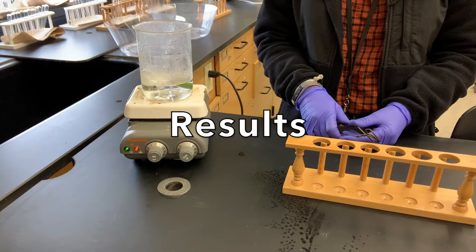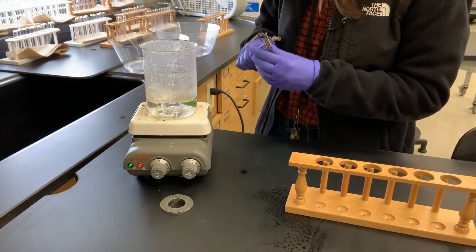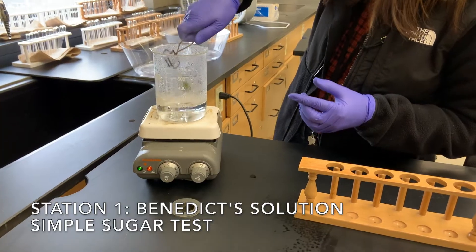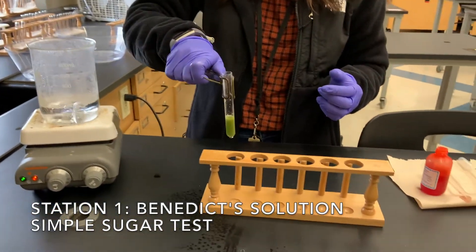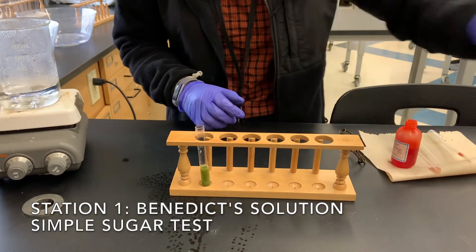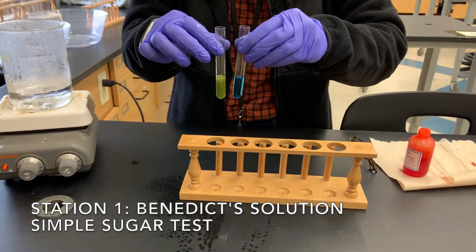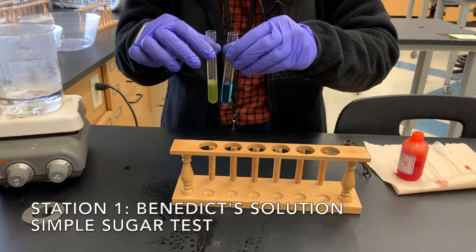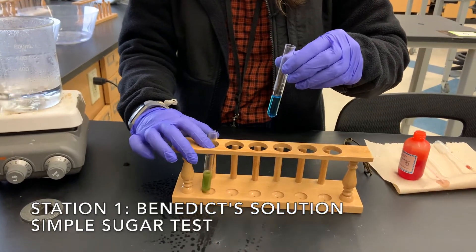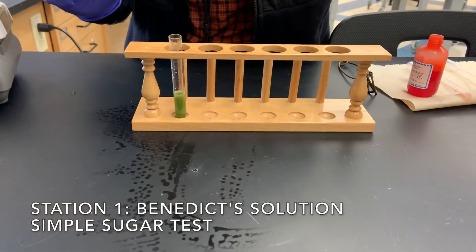Now we are moving on to the results portion of the lab. If you are absent, these are the results you are going to use for your lab. Our first test was testing for simple sugars. We're bringing that out and we can see that it's green. Compared to our control sample, which is definitely blue, you can figure out based on the color what is probably present in the stomach contents of the victim. The result is that the stomach contents turned green while the control stayed blue.